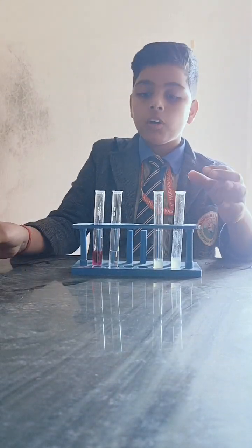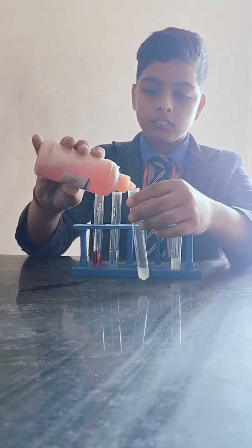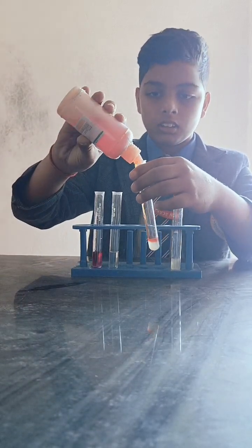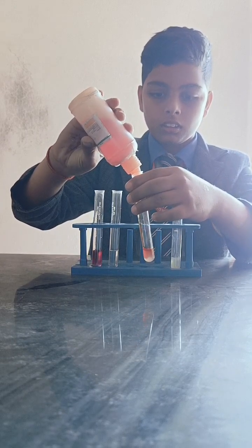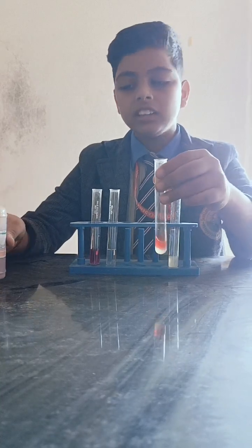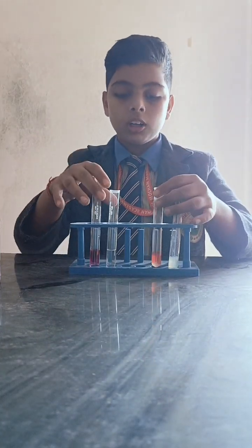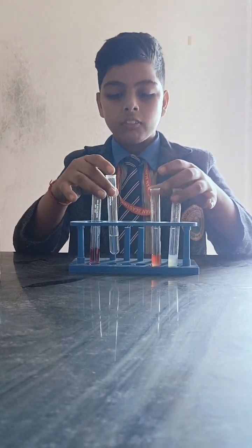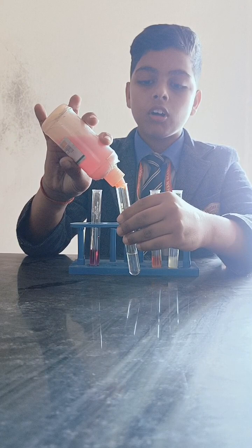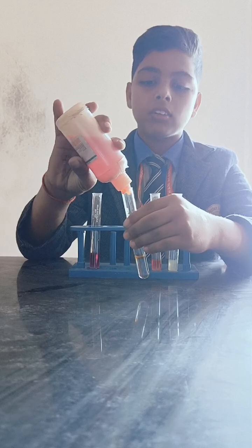But if we talk about methyl orange, so here we have a solution. It changes into red, which means it is an acidic solution. But if we talk about base, then it will change into yellow, because methyl orange turns yellow with basic solutions.